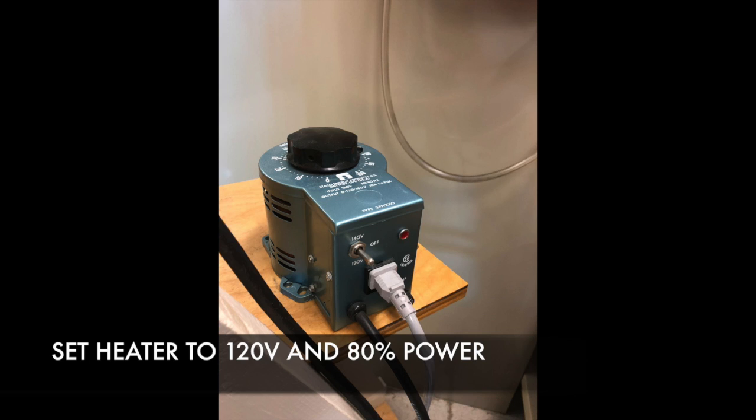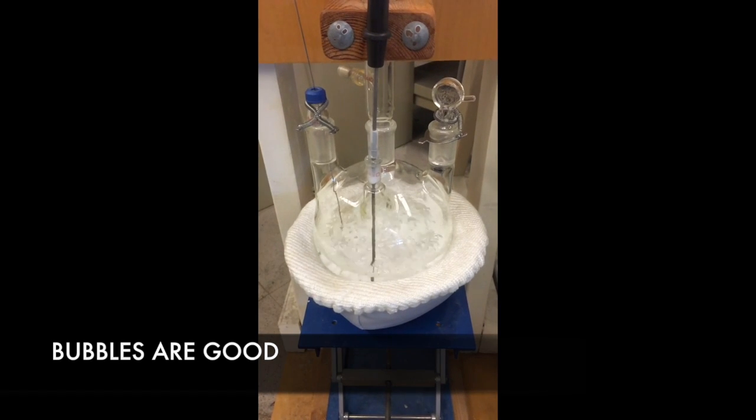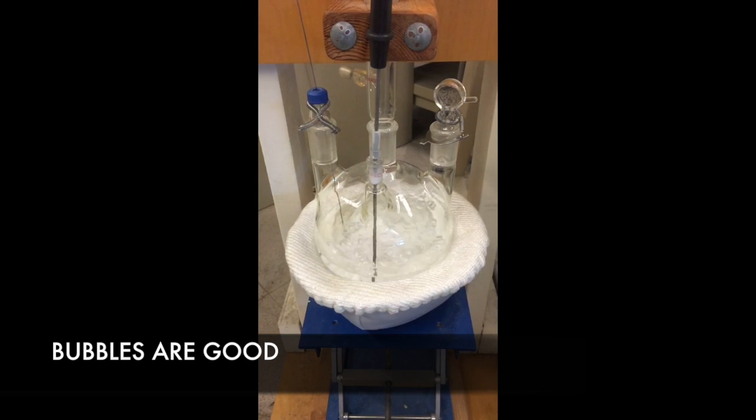Once the heat has been on long enough, you will begin to see the temperature increase on the thermocouple. Watch temperature closely, because if it goes past 85 degrees and there is no formation of bubbles in the reboiler pot, immediately notify your TA, as this can lead to superheating and cause the glass to break. You definitely don't want this happening. As you can see here, we had no problems with this, as we got bubbles.